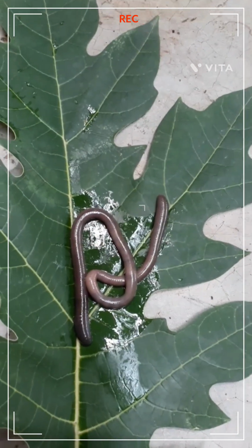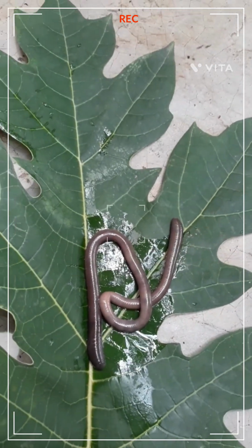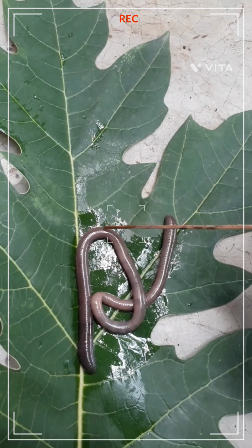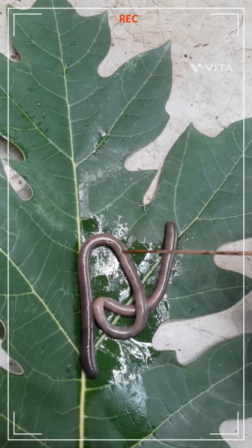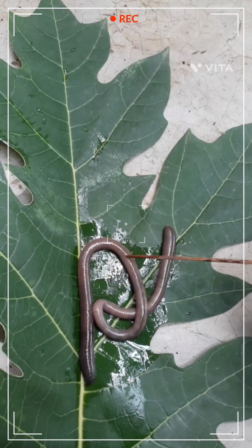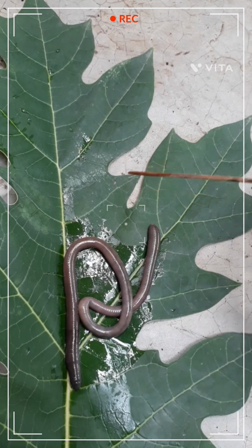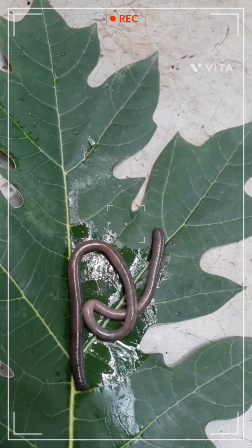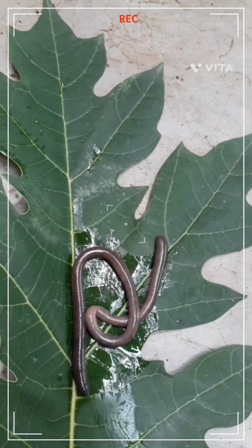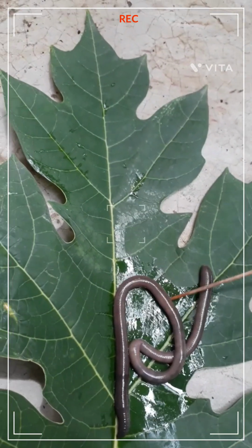In biology, dorsal means back, ventral means front. In the earthworm I am able to see a black color line. Where the black line is lying, this is the dorsal surface. The dorsal surface of the body is marked by a dark median dorsal line. This is the dorsal side.